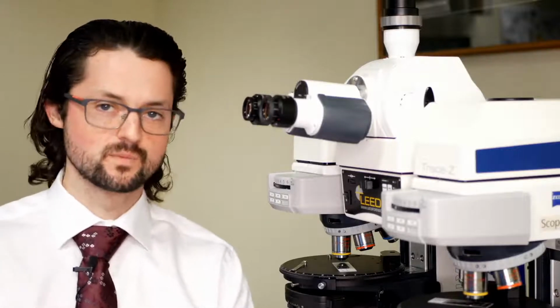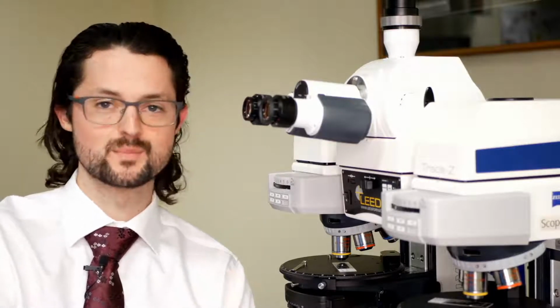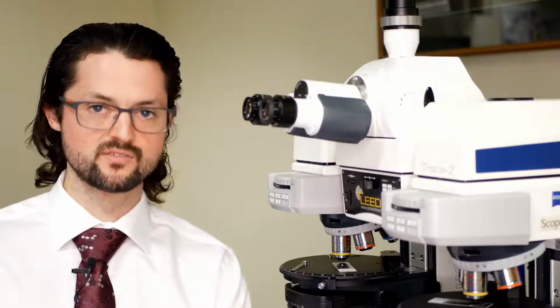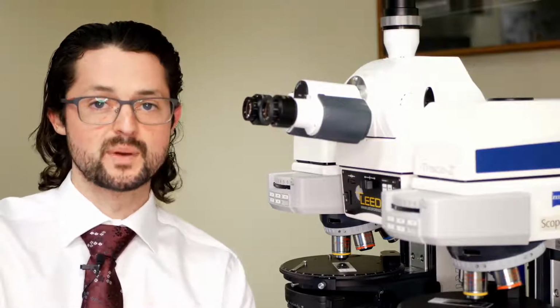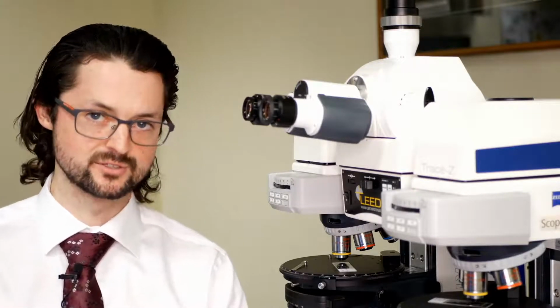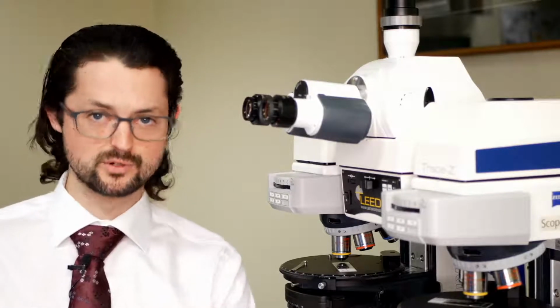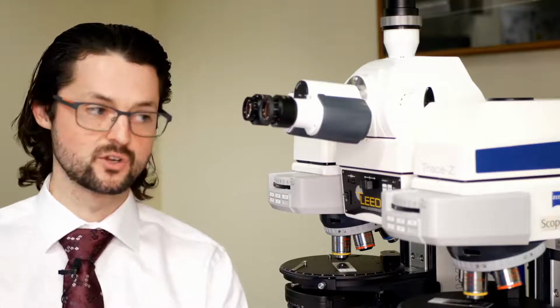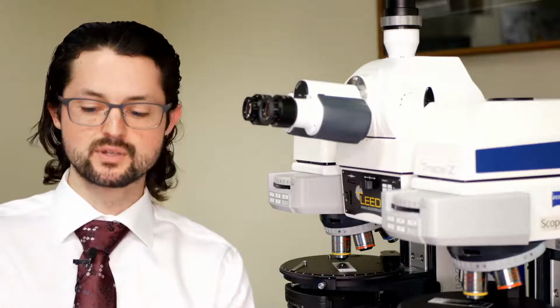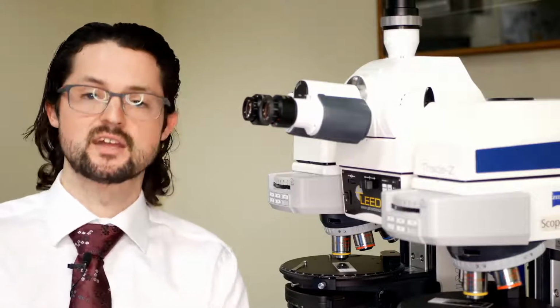So you might be asking, okay, that's great, I've got fluorescence, I've got transmitted light pole, I've got transmitted light Brightfield. Why would I want reflected light pole and Brightfield? Or maybe you've thought about it in the past, but thought that it's too expensive or adds too much complication to your microscope. The big advantage that reflected light Brightfield and reflected light polarized light have when you add it onto a microscope that already has a reflected light illumination system is that it gives you the ability to do comparison work on dark samples or samples that you can't just transmit light through.